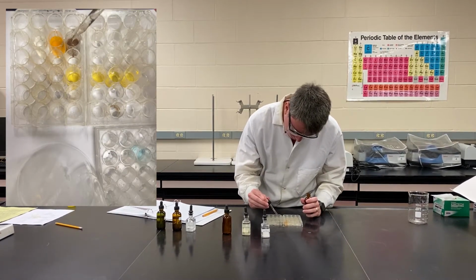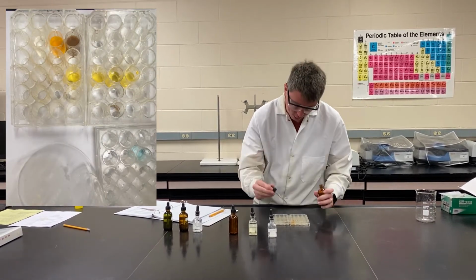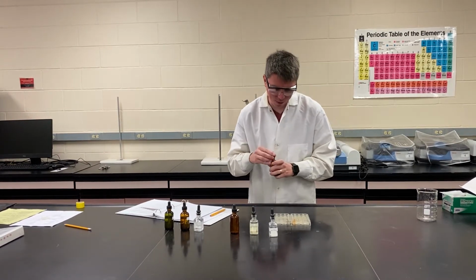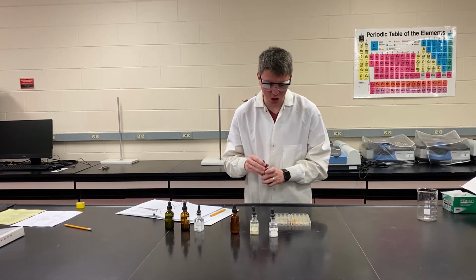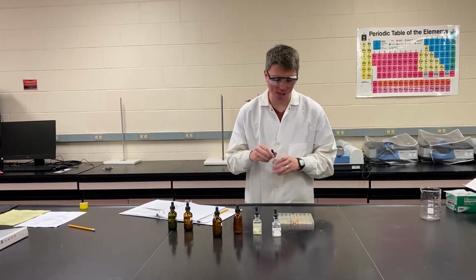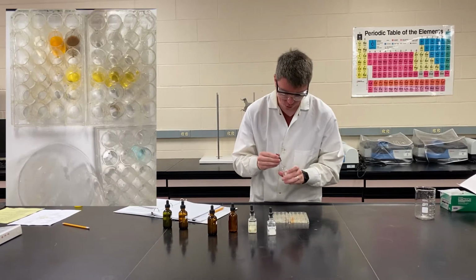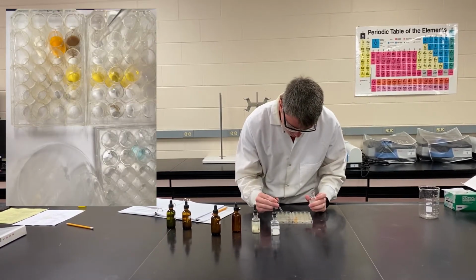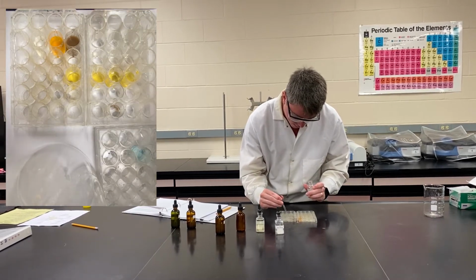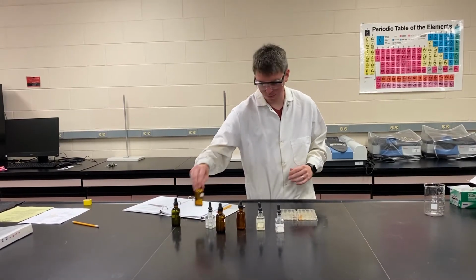So for example, this one, we mixed 2 clear solutions, sodium hydroxide and silver nitrate. But now we've created this brown color to our solution and it's cloudy. So again, another indication that we've had a chemical reaction, and specifically a precipitation reaction, which is what we'll want to note in our data tables that, again, because this is online, will be provided to you.